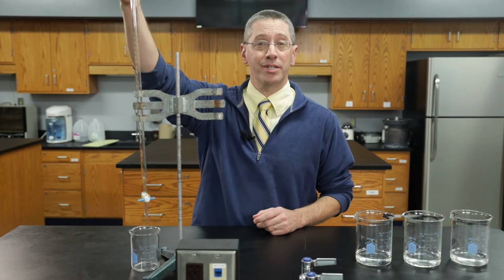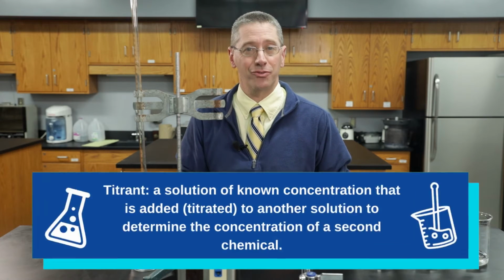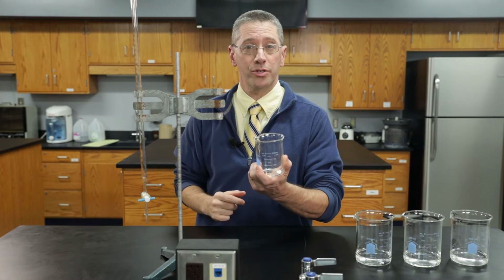The number 0 is at the top, and you put liquid in the top and you can measure it out the bottom. The liquid inside the burette is called the titrant, and generally you know the concentration of it, and you'll titrate it against an unknown solution.